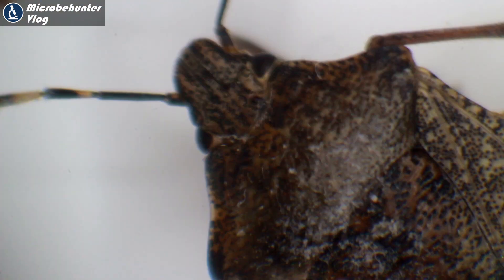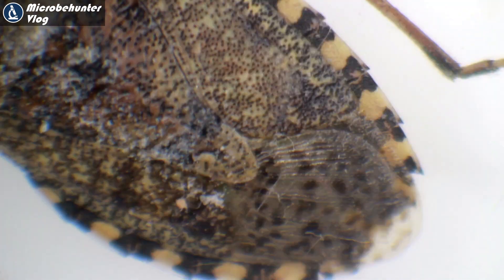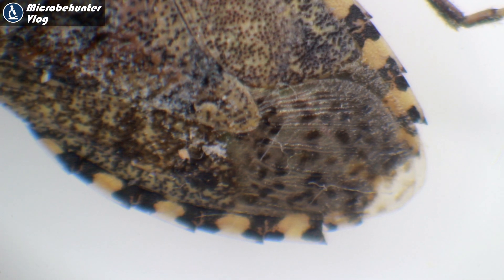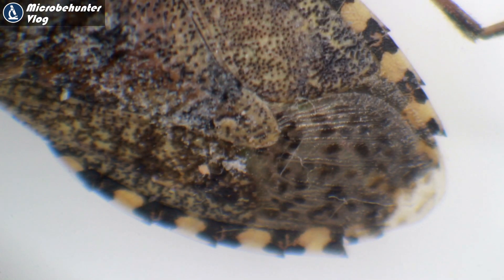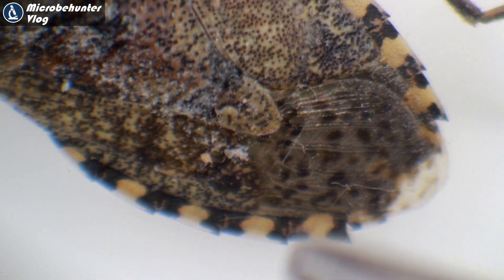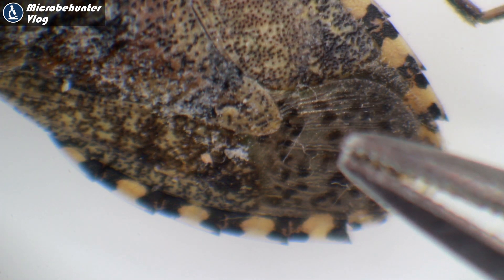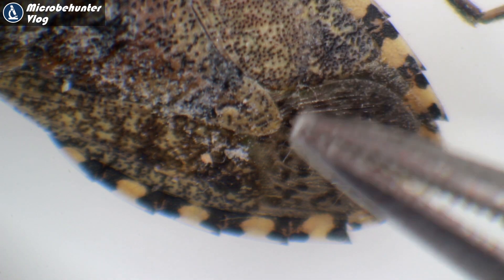I've turned it around now, and here is something I want to explore a little longer. Look at the back part of the wing — this part here is a little bit transparent, very membranous, and it's very typical of bugs.